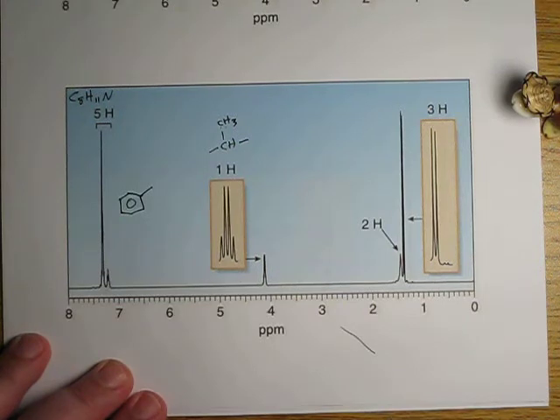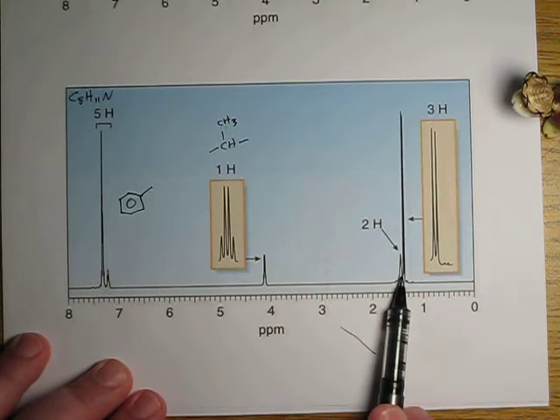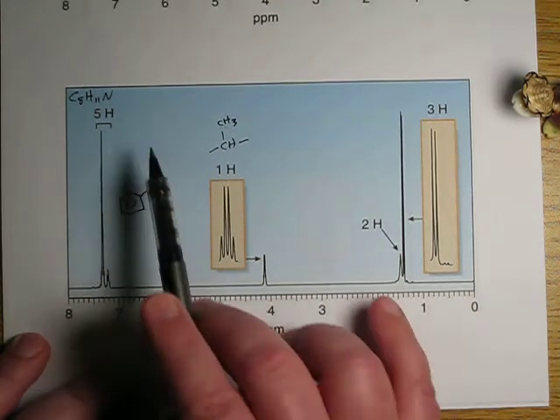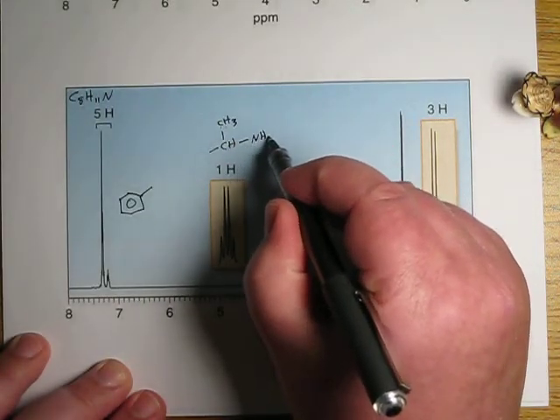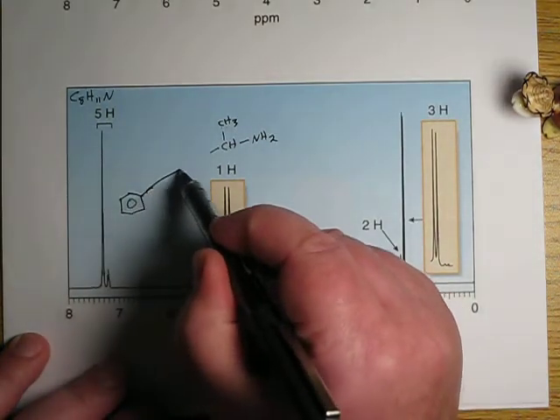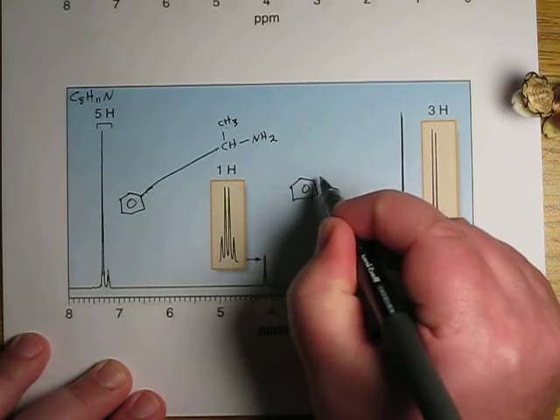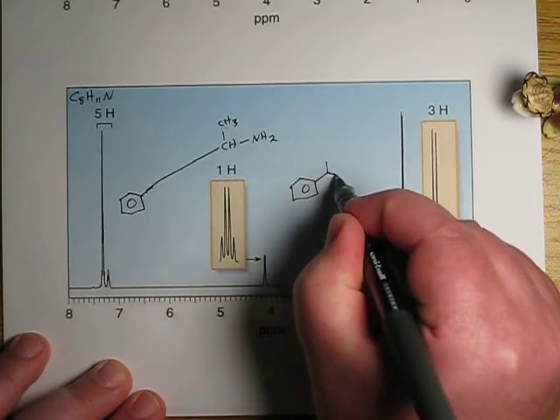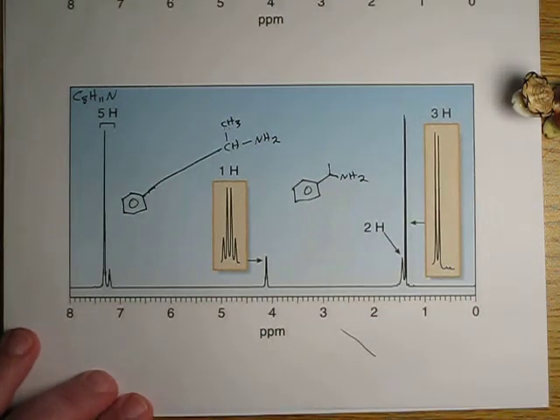Well, what are we left with? We've got this resonance here. It's small. It's a little bit broad. And we notice when we add up our hydrogens and everything, all we're left with is NH2. So let's just extend that. There's our whole molecule. That looks funky. Phenyl ring, CH, CH3, NH2. And there's that molecule. Realize that's how it goes sometimes. Like, well, it could be this, could be that. And sometimes you just ask, well, what am I missing and what makes sense?